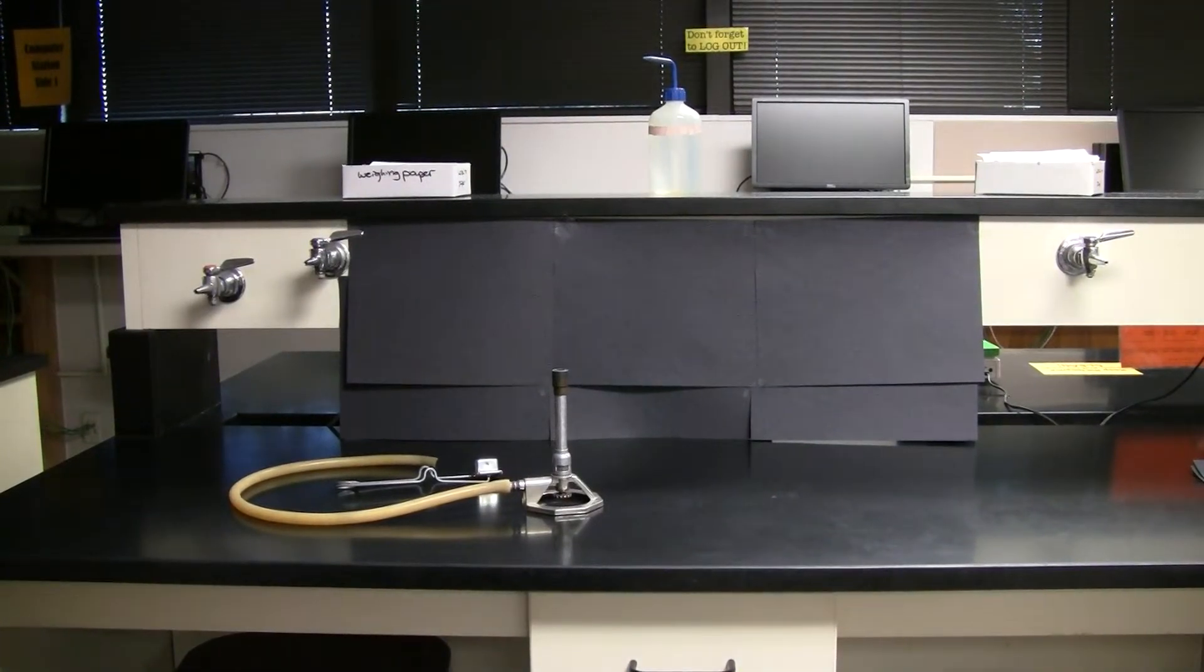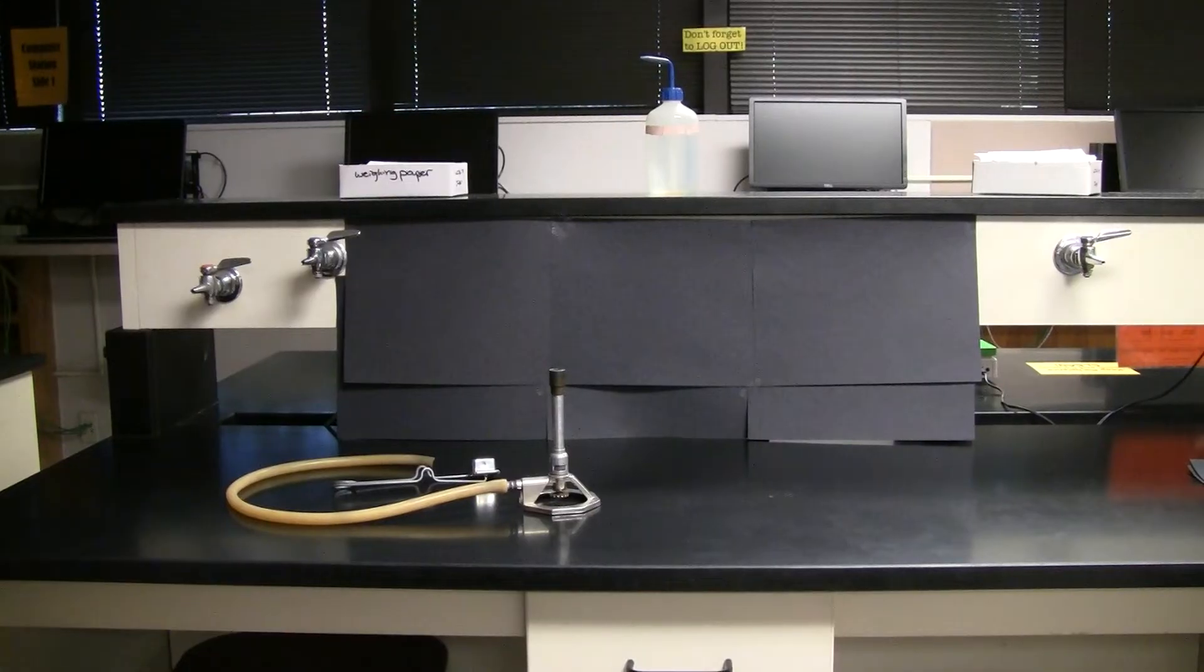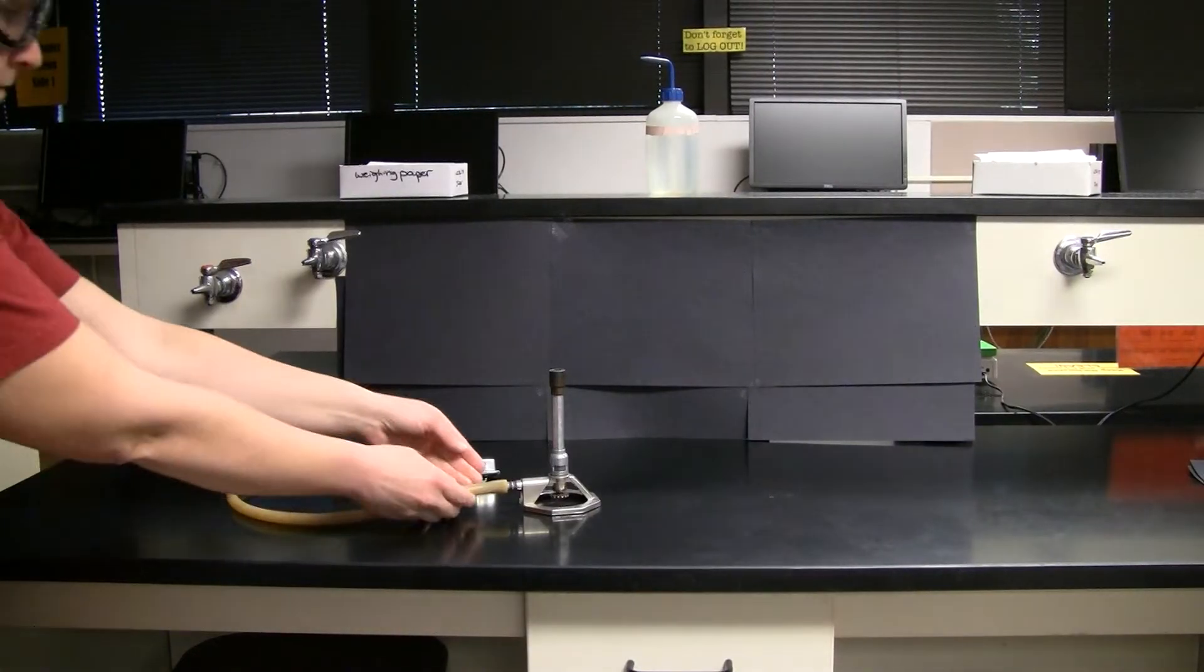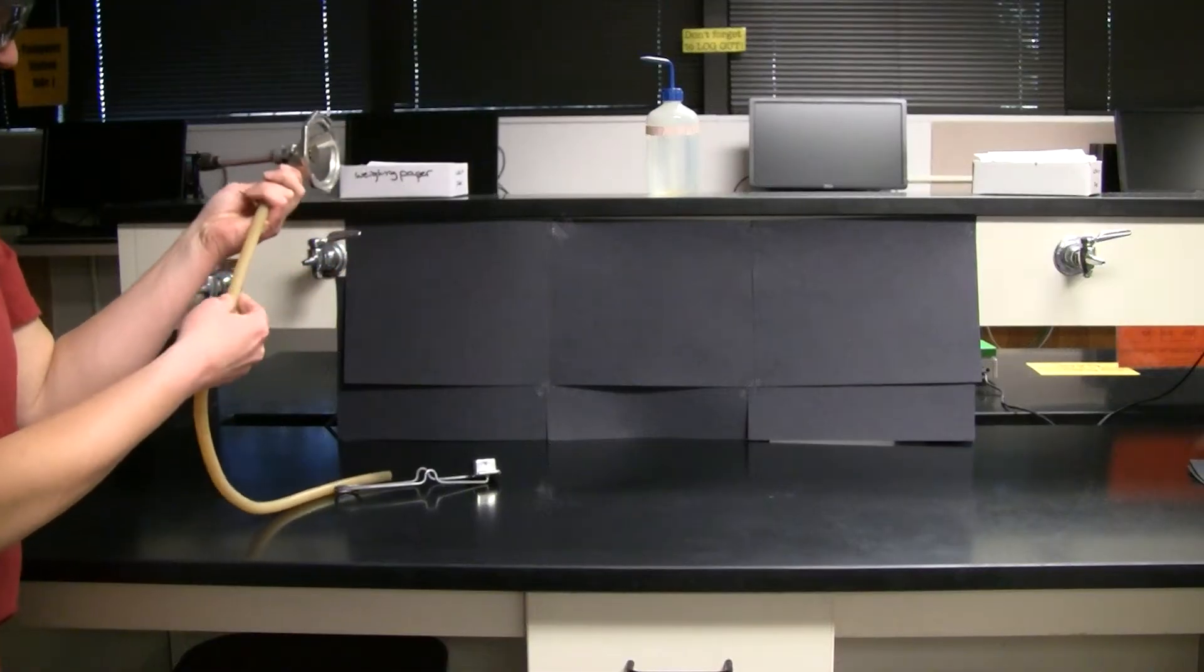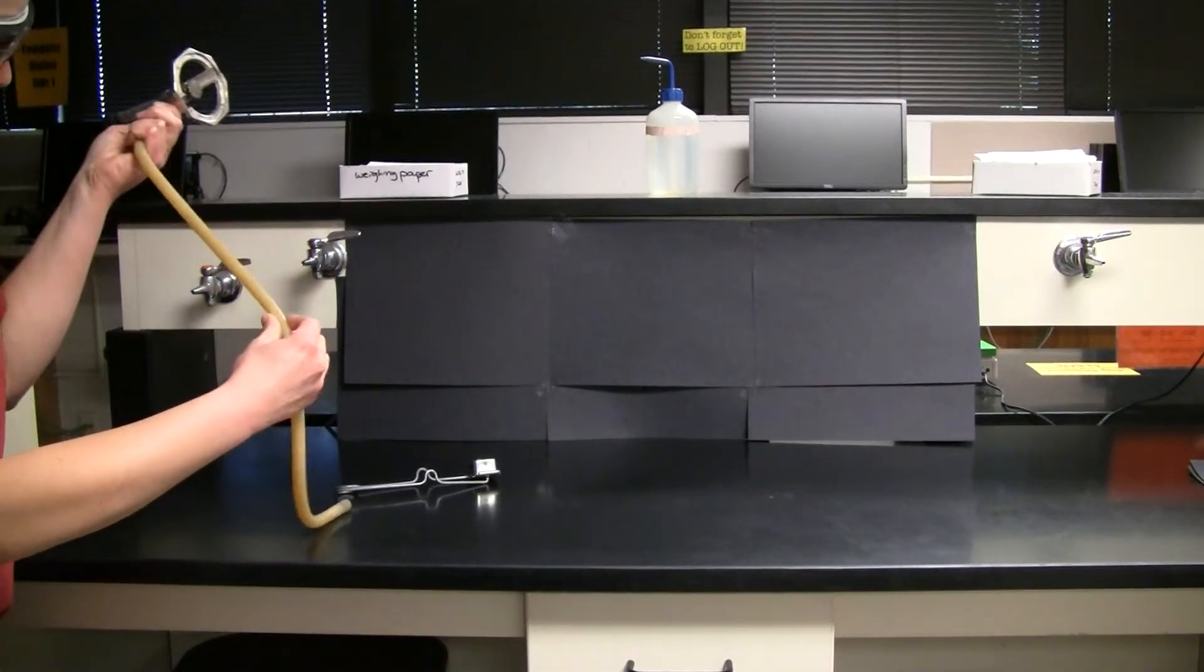When you get your Bunsen burner, you should check a few things first. First, check the hose on the Bunsen burner. You want to double check that the hose is in good shape and that there are no cracks along the hose.